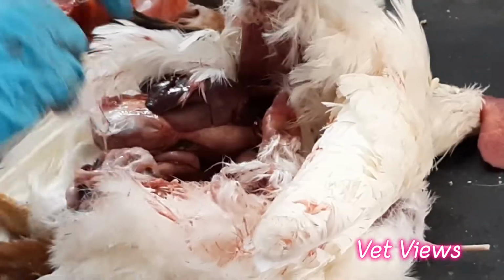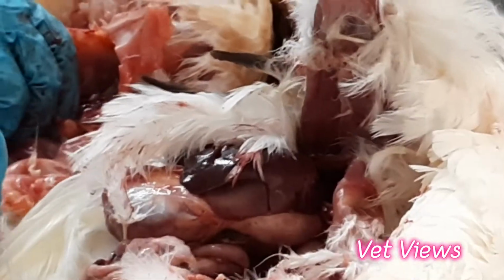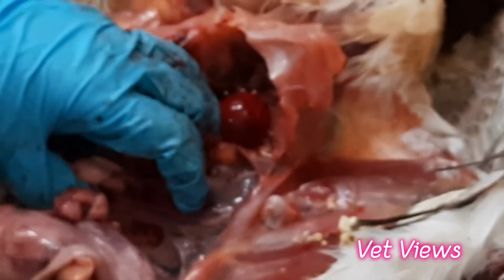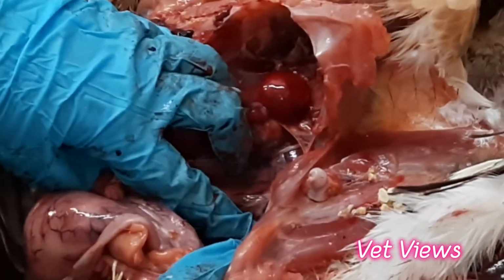See how much it is. This is here. It is normal kidneys. Normal kidneys will have three lobules fixed in the synsacrum. In the membrane, like in the bone cavities, it will get filled up. So there will be three pairs of lobules, and then there will be ureters that come and join in the cloaca. This is a normal kidney consistency of the lobules.